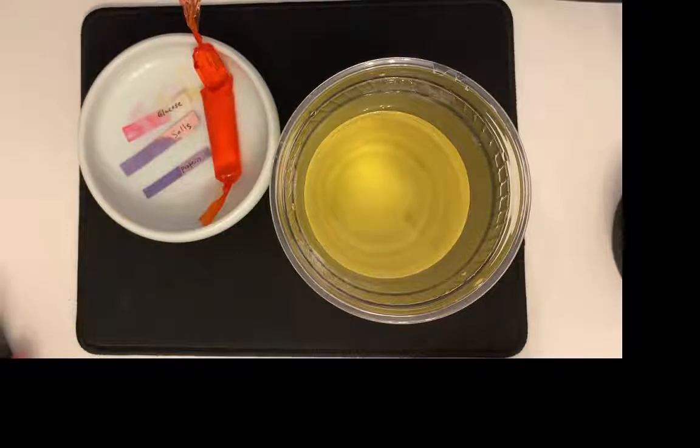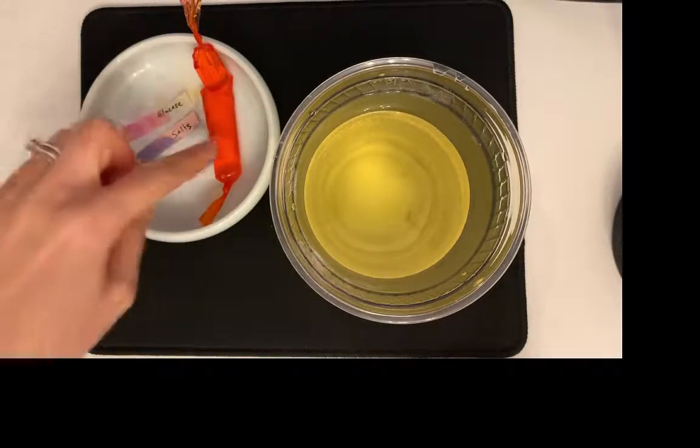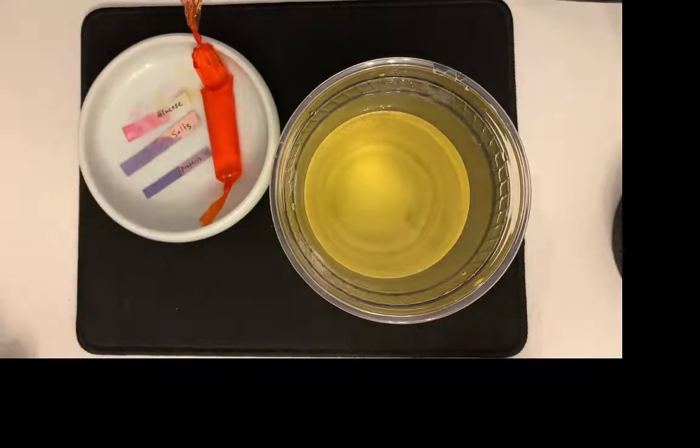Is there blood in the dialysate? Well, I don't see any blood in here. It looks like the blood just still stayed there and did not cross through into the dialysate. And then as for the others, you can go ahead and answer these questions if they are present in the dialysate after dialysis. Now, as far as testing the blood, I don't know that we needed to test the blood afterwards.